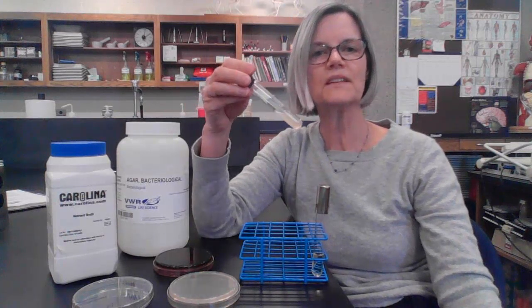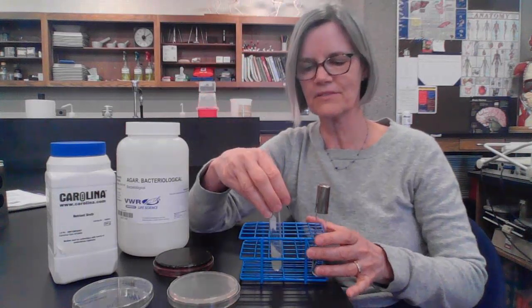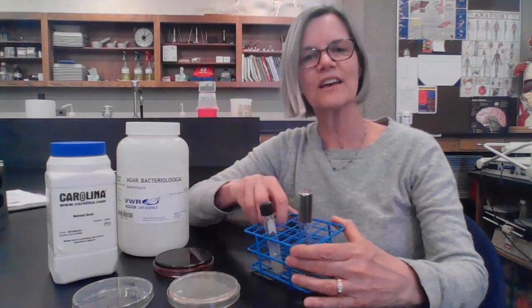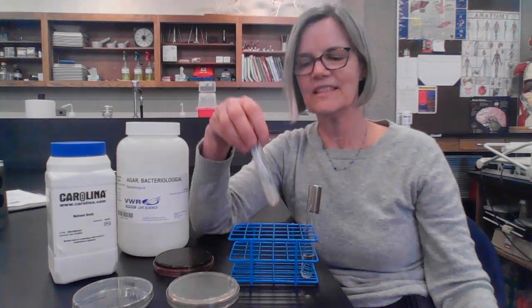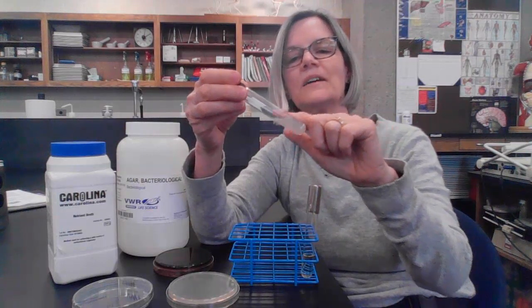And so the liquid form, sometimes we pour them into screw cap test tubes, and we cool them kind of on a slant. So we'll have special racks that cool at an angle like that, and the agar slants will end up looking like this. And so there's a solid medium in there, and I have a nice slanted surface.